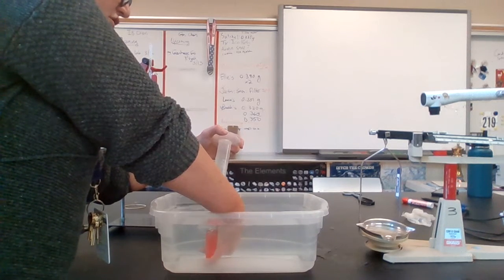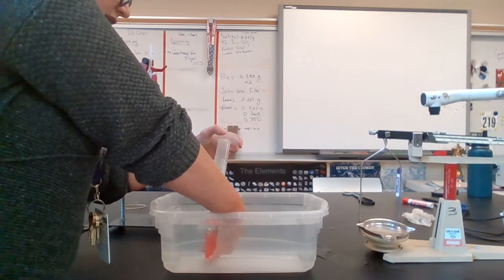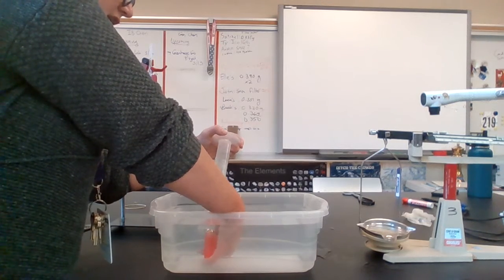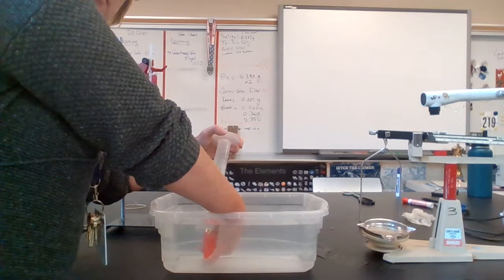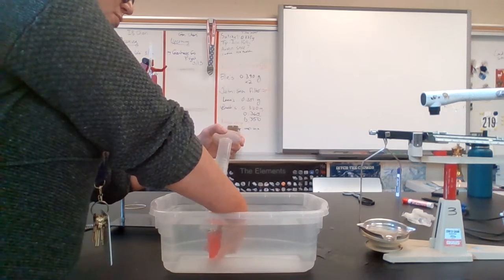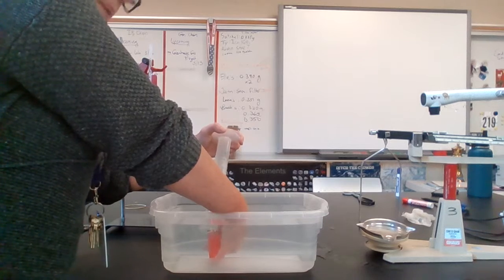I'm going to let this go for a bit until I have collected 80 milliliters of gas, displacing 80 milliliters of water.